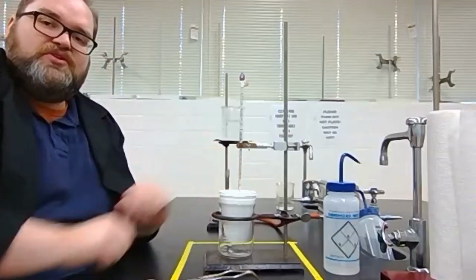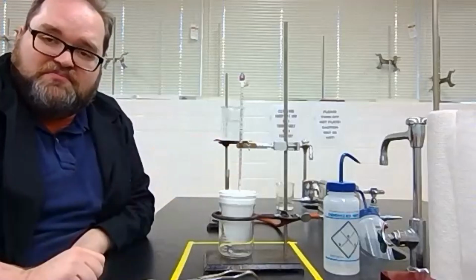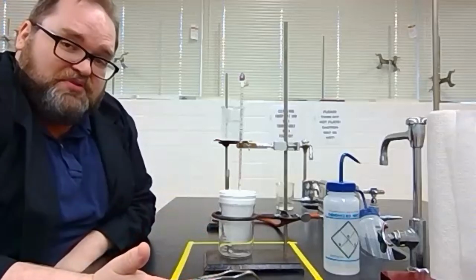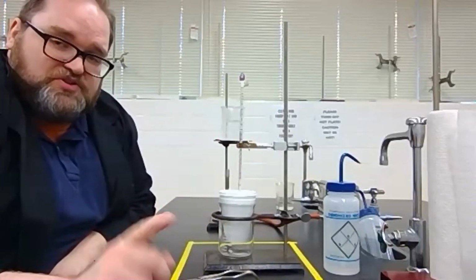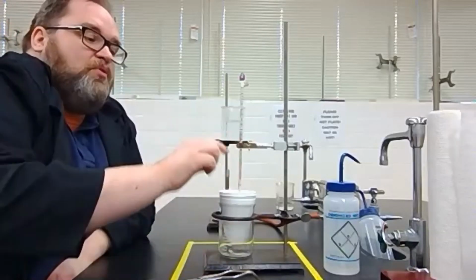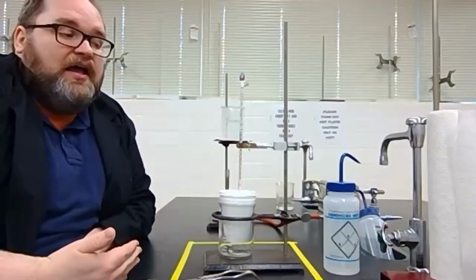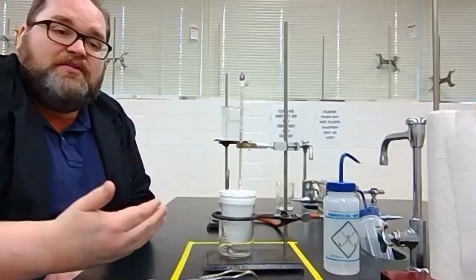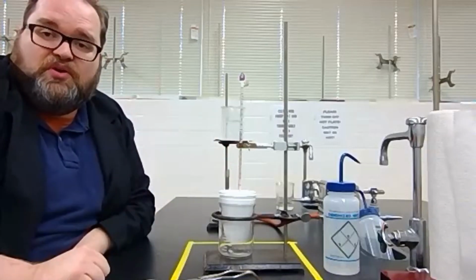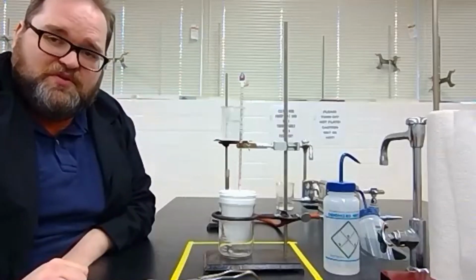When we pour those 2 solutions together, they're going to change temperature. So we're going to use the thermometer to measure the temperatures before we mix them. At room temperature, they should be the same temperature, so you really only need to measure one, but you always measure both, just to make sure. And once we've got those initial temperatures, we can pour them together, and we can watch if the temperature goes up or down. If this is an endothermic reaction, the temperature is going to go down for the water. And again, the lowest temperature is the temperature we want. If it's an exothermic reaction, the temperature will go up, and the highest temperature is what we want.